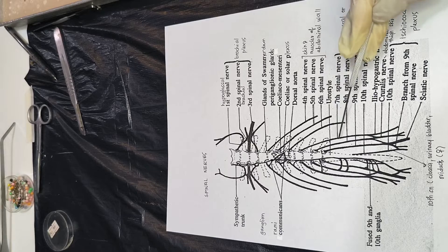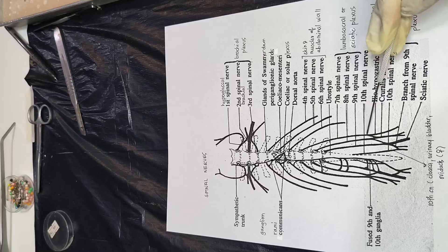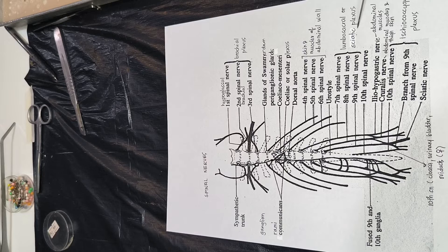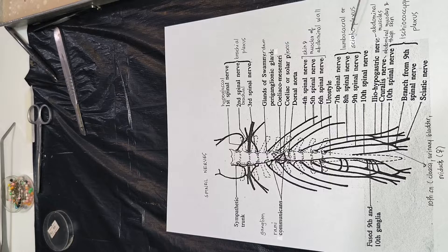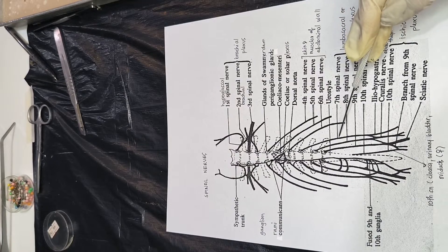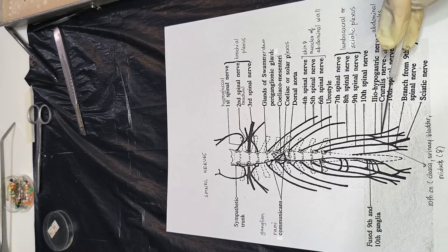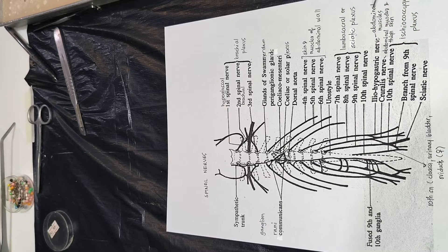The seventh, eighth, and ninth spinal nerves form a plexus — called the lumbosacral or sciatic plexus — which innervates the lower back and also the hind limb. Taking note of the seventh spinal nerve: prior to forming a plexus, it gives off a branch called the ileo-hypogastric nerve, which innervates the abdominal muscles.